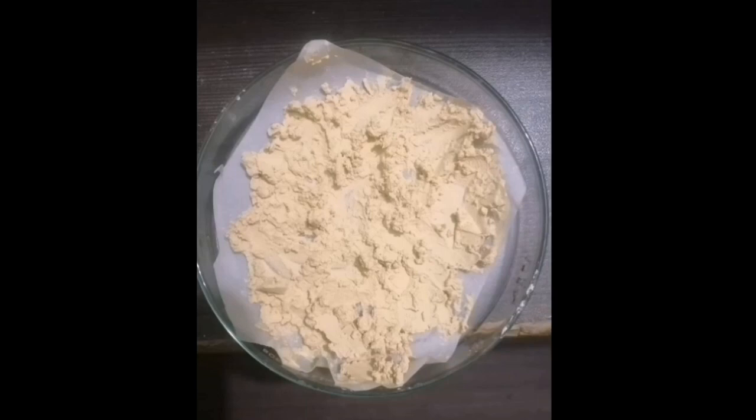And these are the solid crystals, paste-like material of bromo chalcone, as they are not completely dried. But leave it to dry completely. When they are completely dried, then do its NMR. If they are not completely dry, then in proton NMR, water peaks and moisture peaks will appear. So leave it and dry it completely. So this was all about the process of synthesis of chalcones.